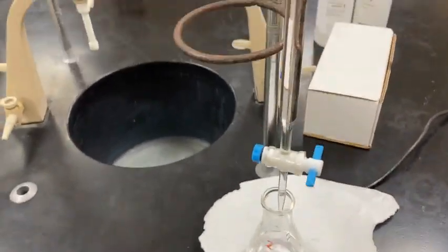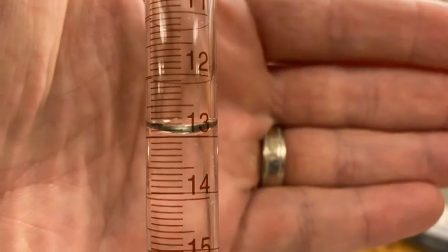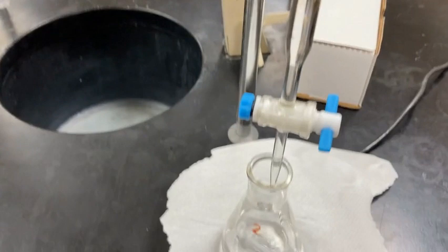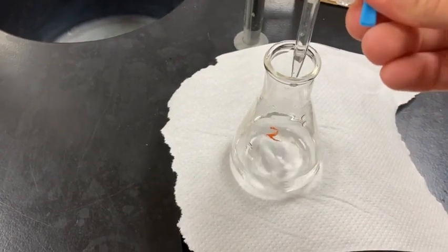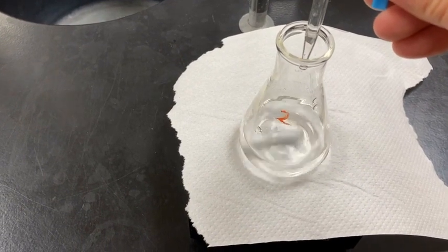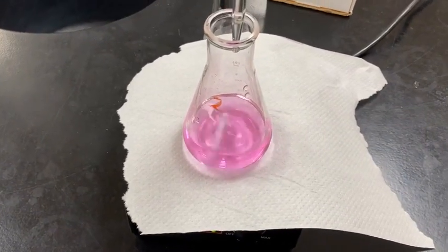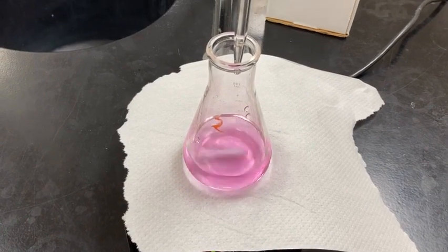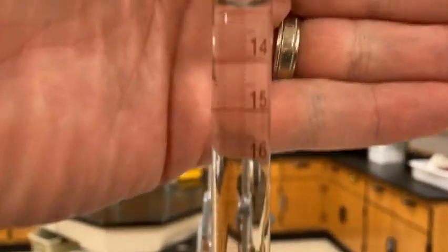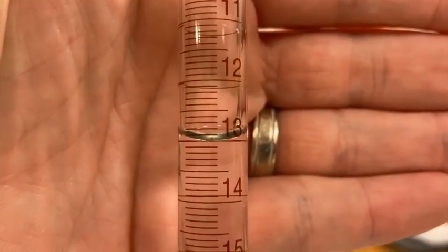All right, if you like that, let's get the volume for you. If you don't like that, what I'm gonna do is add 1 more drop and get the new volume after this. So I'm giving you guys some choice here. Where is the end point for this titration? I'm gonna add 1 more drop, try not to mess it up. If you like this as your end point compared to the last one, I'll let you get what the new volume is based off that 1 drop I just added. Ever so slight. Okay, cool.